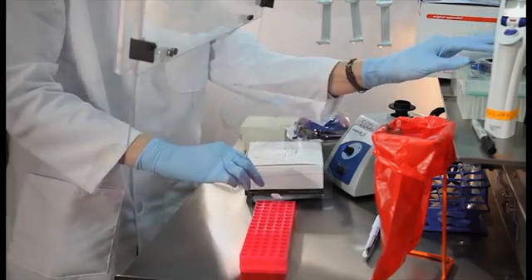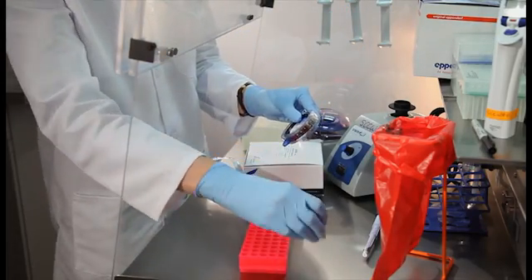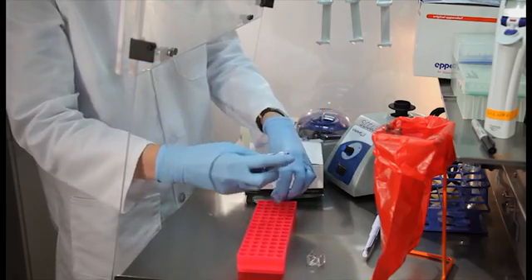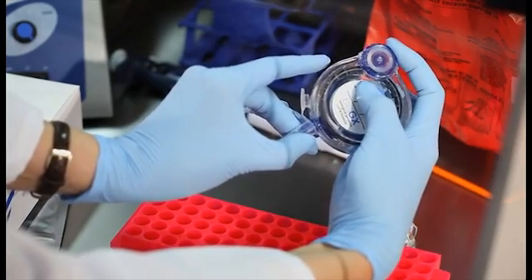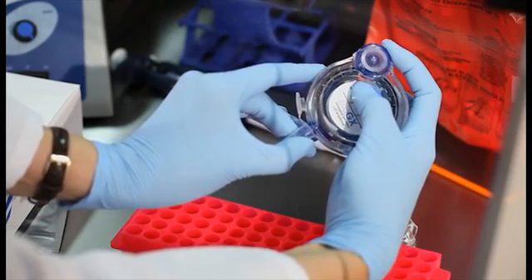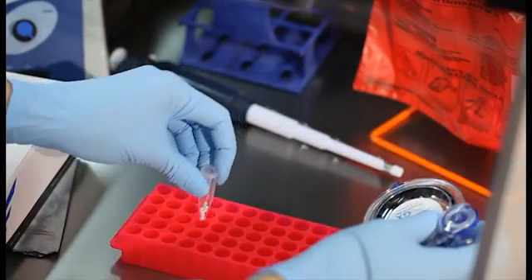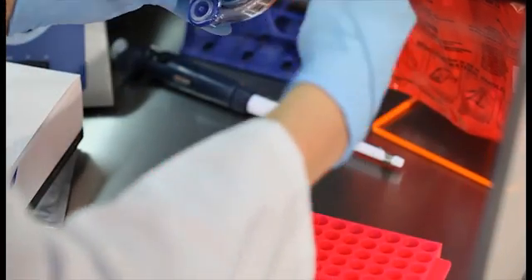The primers and probe for the specimen processing control also come in bead format. These beads are packaged in an easy-to-use dispenser. Each of these beads contains enough material for four qPCR reactions, so only half as many primer probe beads need to be added to the microtube containing the Omnimix beads.